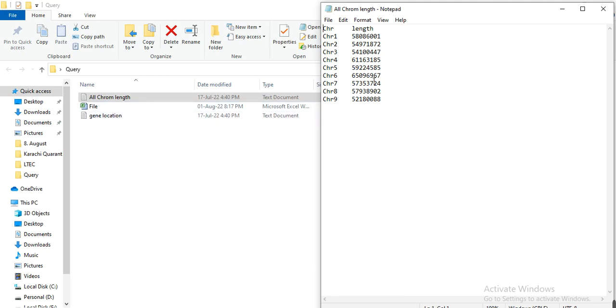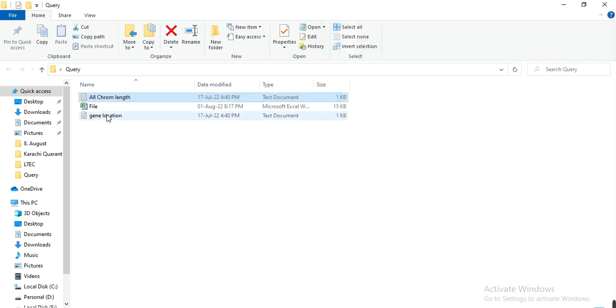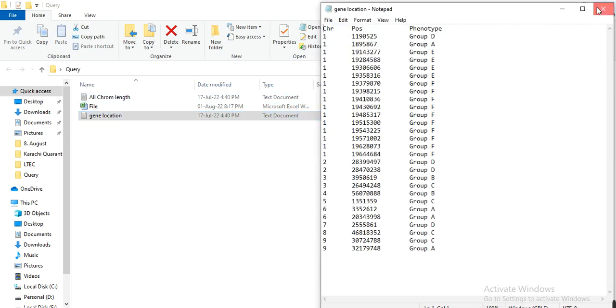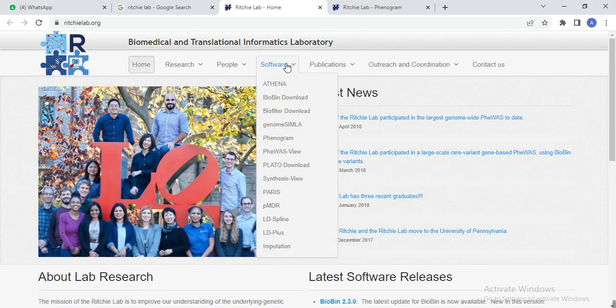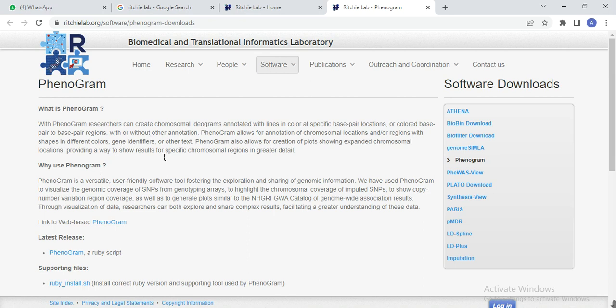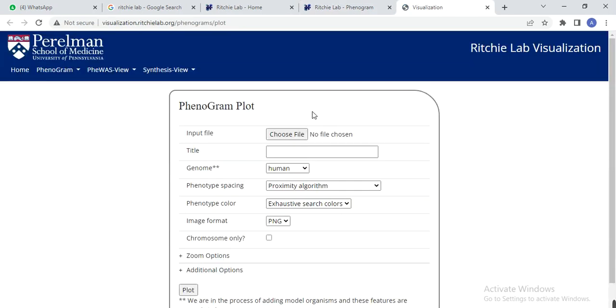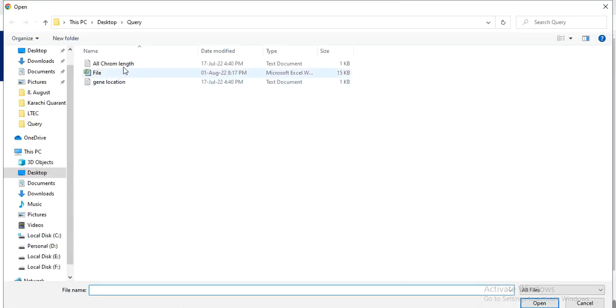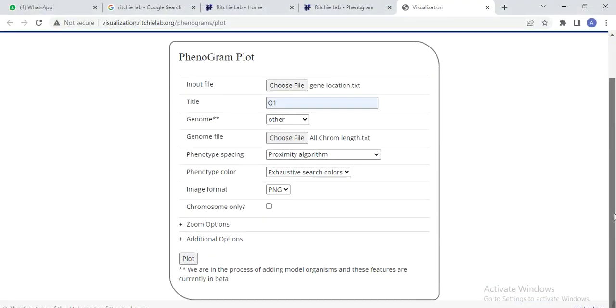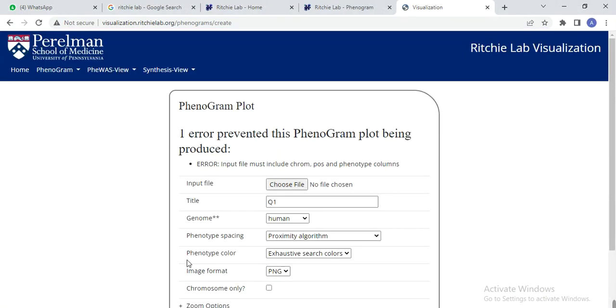When you look at these two files, they look okay. So let's try this file. First you go to Google and write Ritchie Lab and open the first link, then go to the software and choose Phenogram. This window appears, then click on Phenogram and choose your files. Here is the gene location, and another one we can call the query one or any other name that you want to give, and here is others, and choose the all chrom length. Then click on plot.